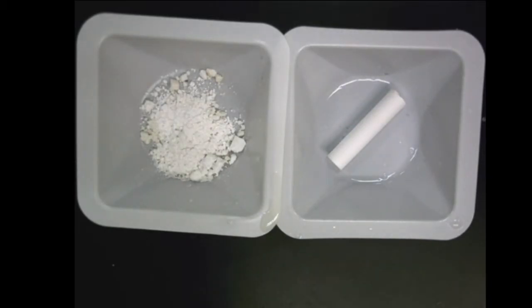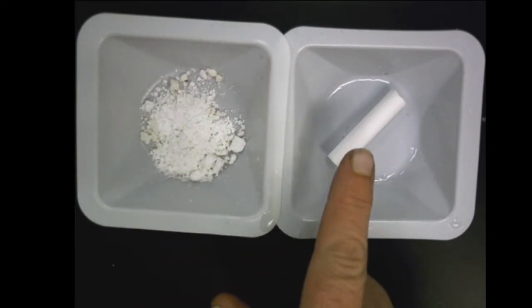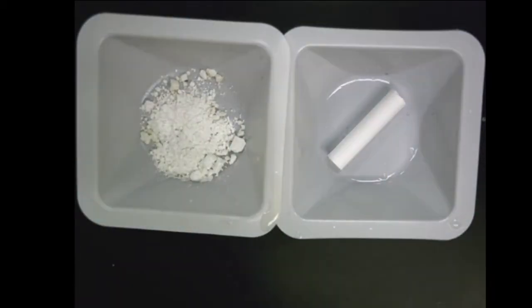So what is your claim? Do you think the reaction between the vinegar and the chalk is going to be higher in the whole chalk or the crushed chalk? Where's the rate of reaction going to be higher? All right, so here we go. You should have already made your observations for before, of what this chalk looks like and what this one looks like. And now you can see the during.